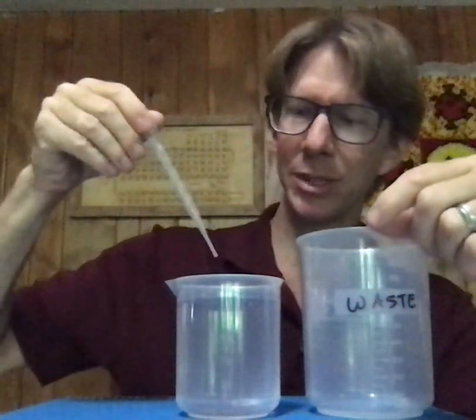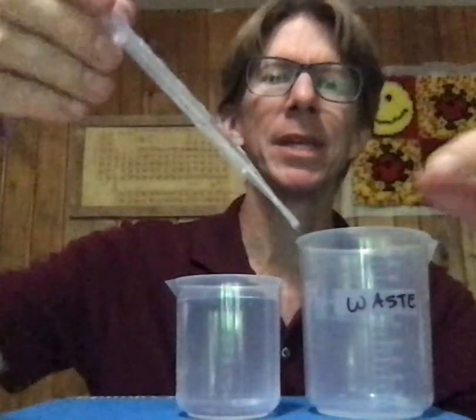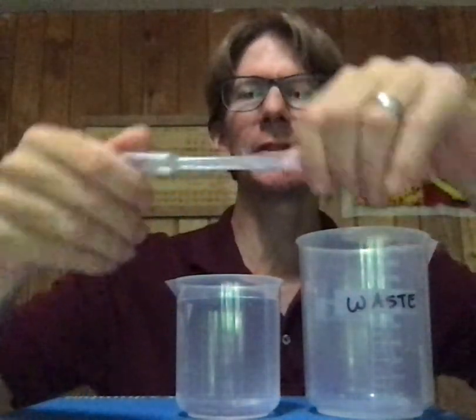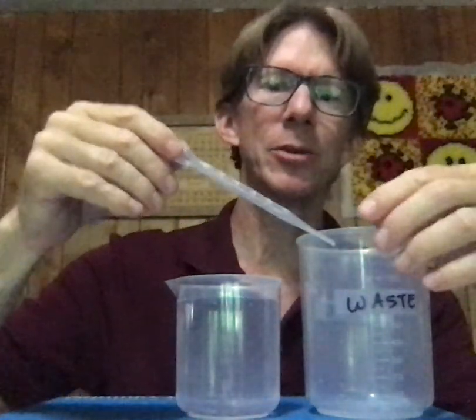Conditioning always takes a small amount of solution or water — in this case water — and puts it into the pipette. You can tilt the pipette to allow the water to run around and coat the entire inside surface. And the reason we use just a small amount of solution is so that we minimize the waste of our solution, or our water in this case.